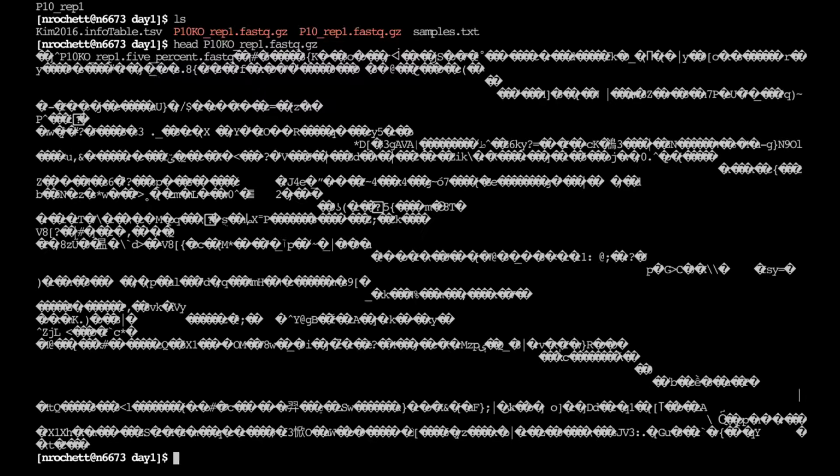But essentially, when you start seeing these weird characters here, question marks in my case in the diamond, it means you're looking at a binary file in text mode. You're trying to look at the binary file as if it was text. And this is binary because it's compressed. Any compressed file is always going to be binary. So what we need to do is decompress the file with, for instance, zcat.